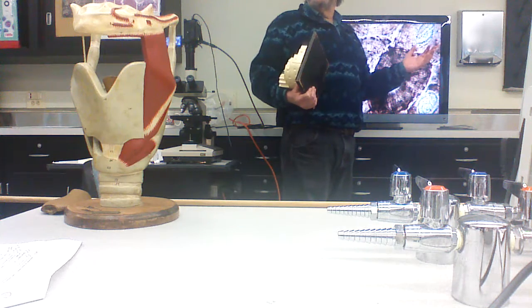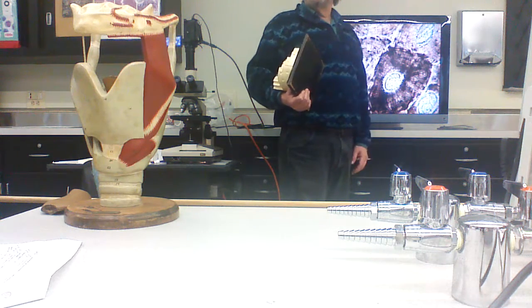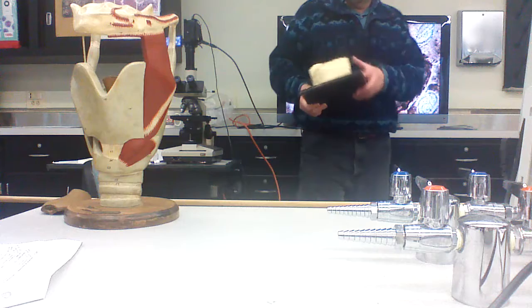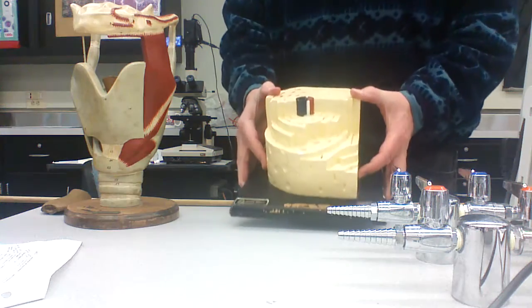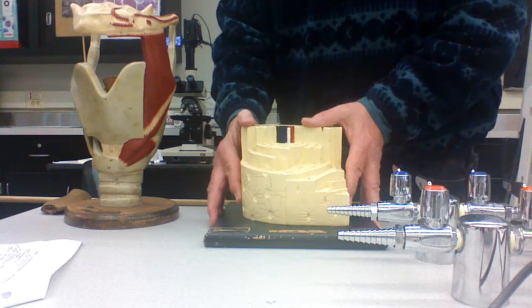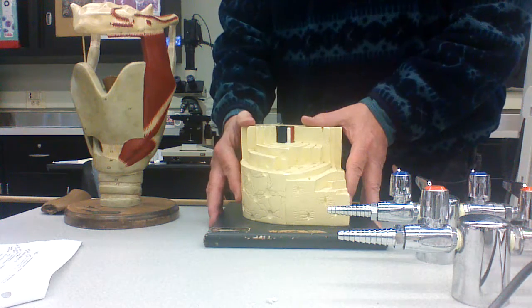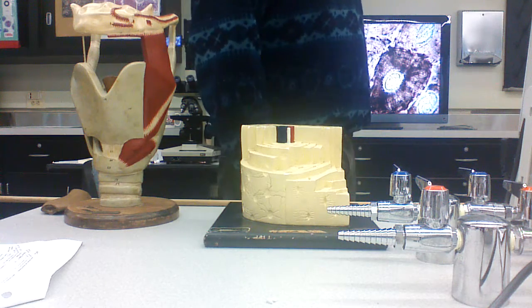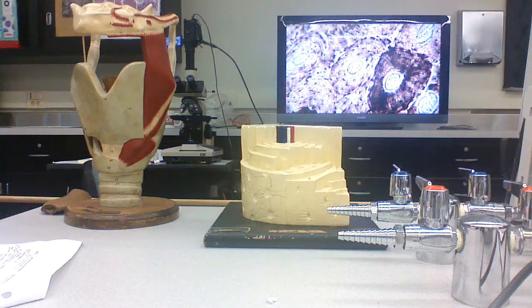Oh, gee. What's the name of that connecting canal? Canaliculi? No. It begins with an M. Volkmann's? But I'm blanking on it. You mean the Volkmann's canals? No. Who's got a book? Sometimes I blank on it. Do you have your phone there?